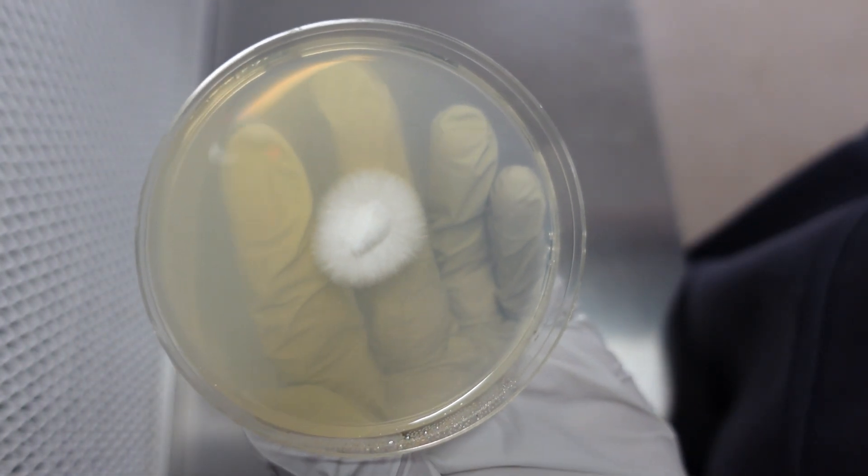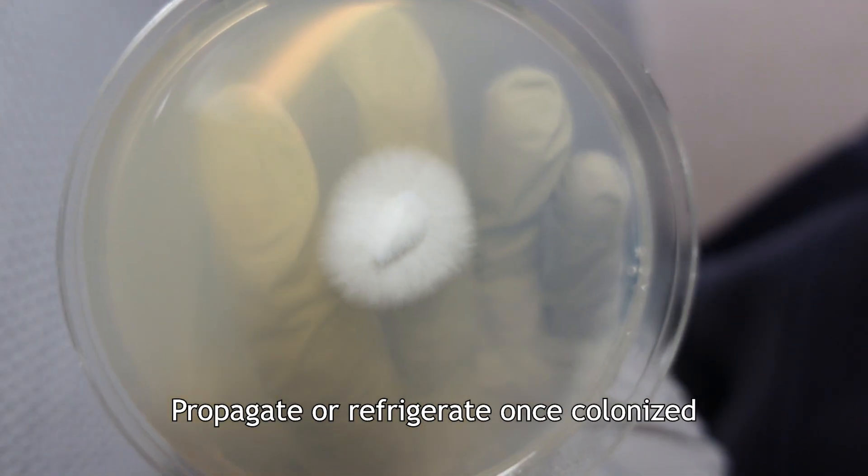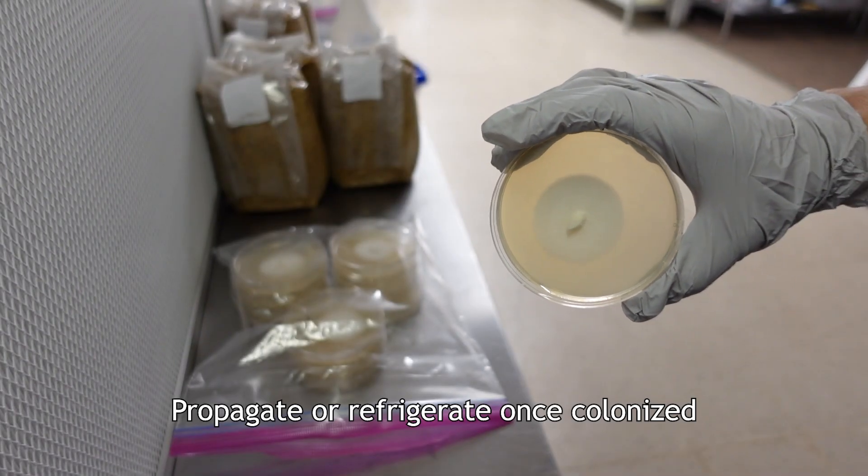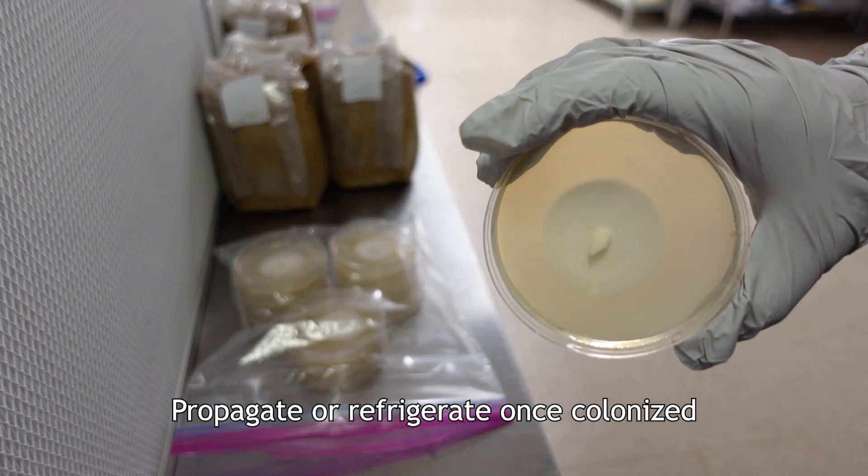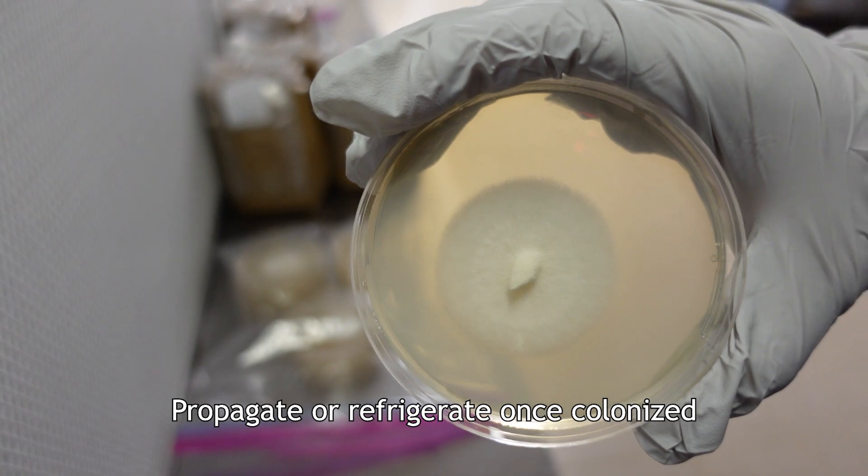Let the clean culture incubate until the agar plate is mostly covered with mycelium. Once your plates are nearly fully colonized, it is time to propagate them or store them for future use. Most varieties can be refrigerated for about a year, or sometimes longer.